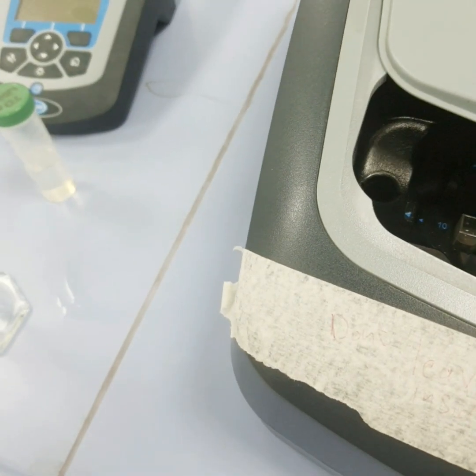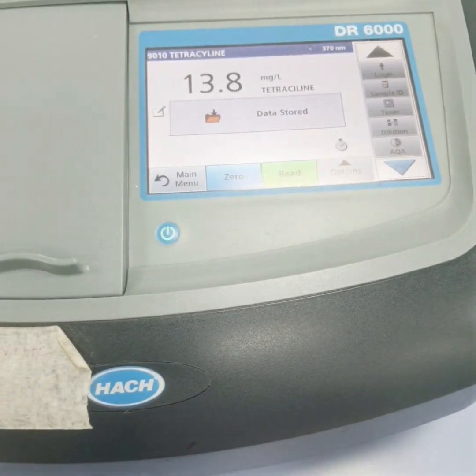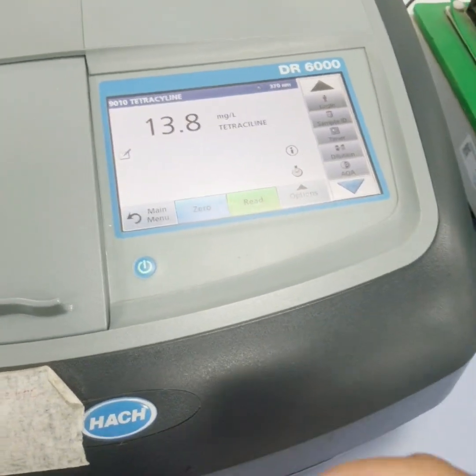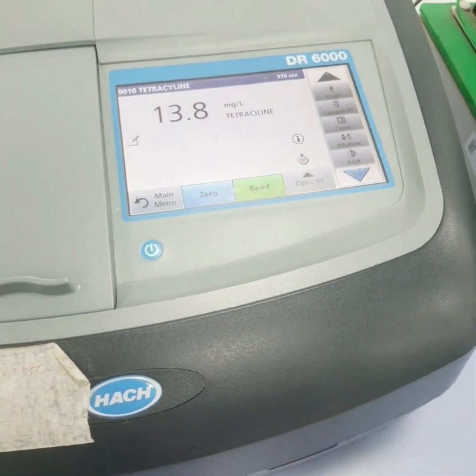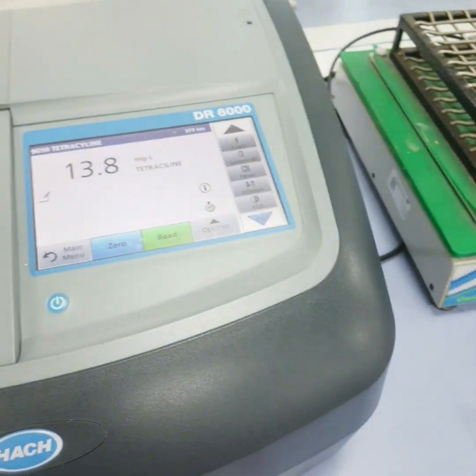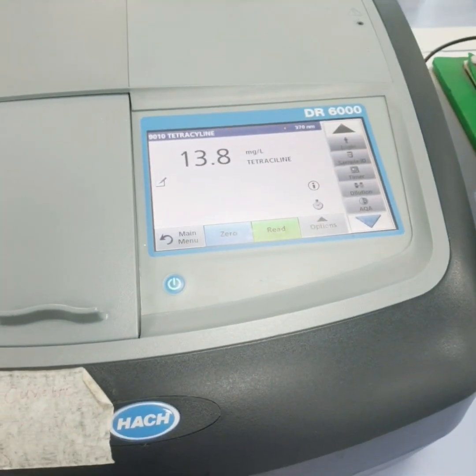Now we will measure this. You can see it significantly dropped from the first batch, or first set point pressure. Earlier it was around 21, now this is 13.8. So at the higher pressure the time required for collecting the sample also dropped, and the separation now is much better than the first one.